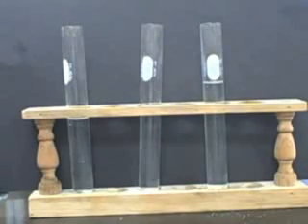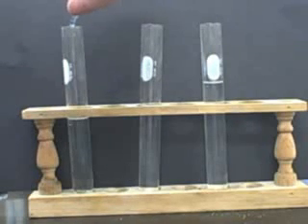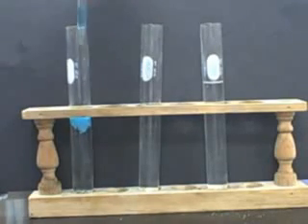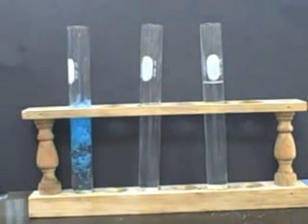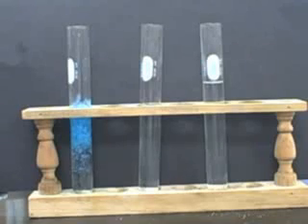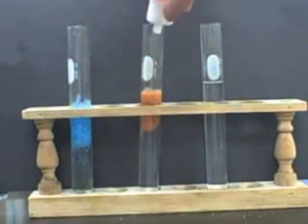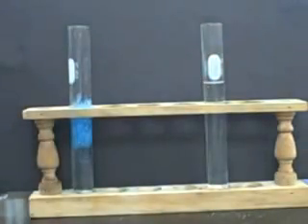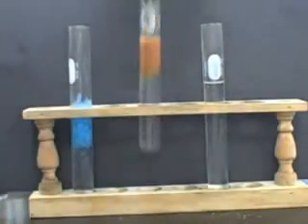Alright, so now we're doing transition metal carbonates. So we've got copper sulfate and sodium carbonate. You can see, actually that's almost the same color as the copper hydroxide. A little darker in color. The surface just bulged a little bit. Yeah, a little bit darker in color. And then we've got iron chloride, and adding that to our solution of sodium carbonate. It's actually, wow, look at that.